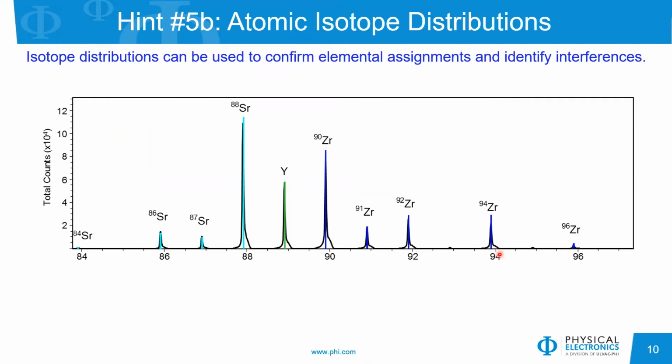Isotope distributions are also quite useful for looking at elemental samples. So this particular example is from a solid oxide fuel cell that has a number of elemental components in the matrix. And this is showing the expected isotope distributions for strontium, yttrium, which has only a single isotope, and also the zirconium elements. I would add, just as a precaution, in the isotope tool in the software, you can only do one set of elements at a time. So you would see either the strontium or the zirconium or the yttrium. It wouldn't give you all three of these calculated distributions at the same time.